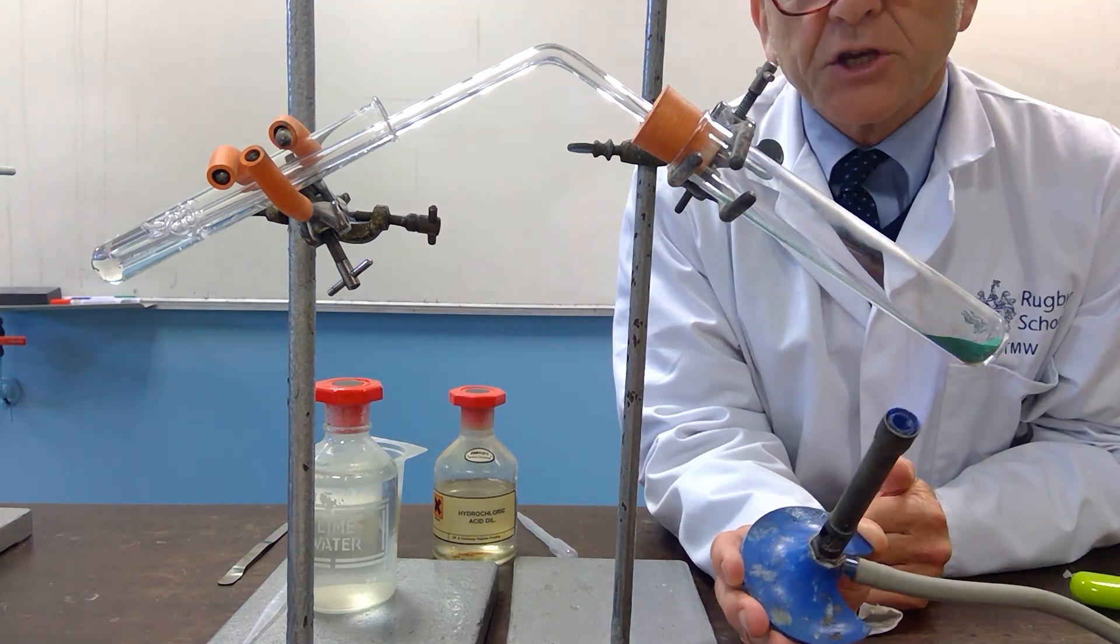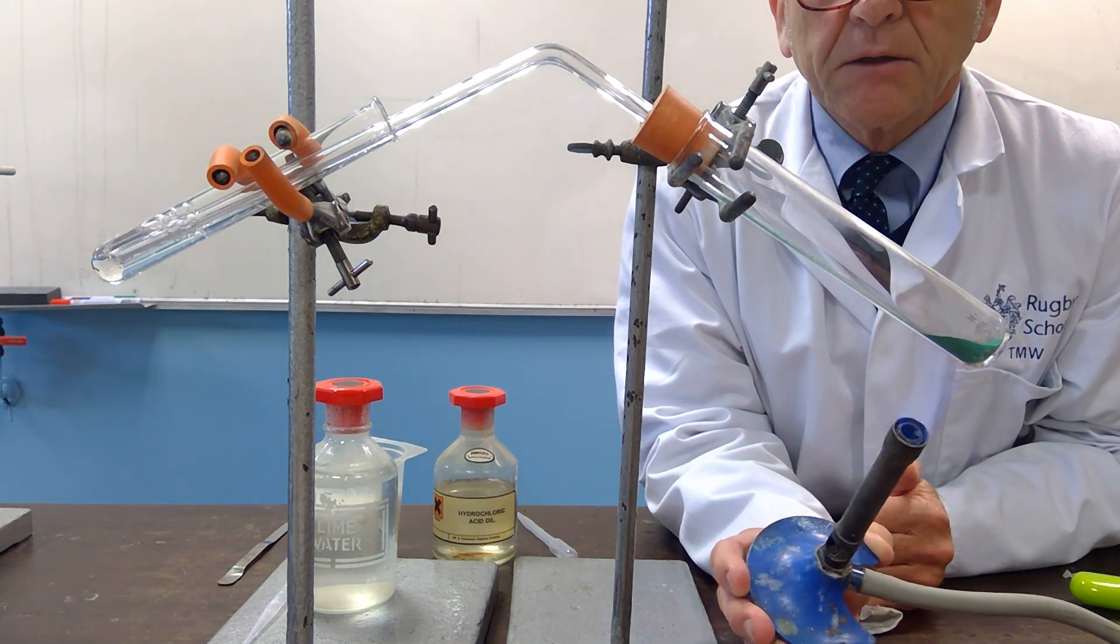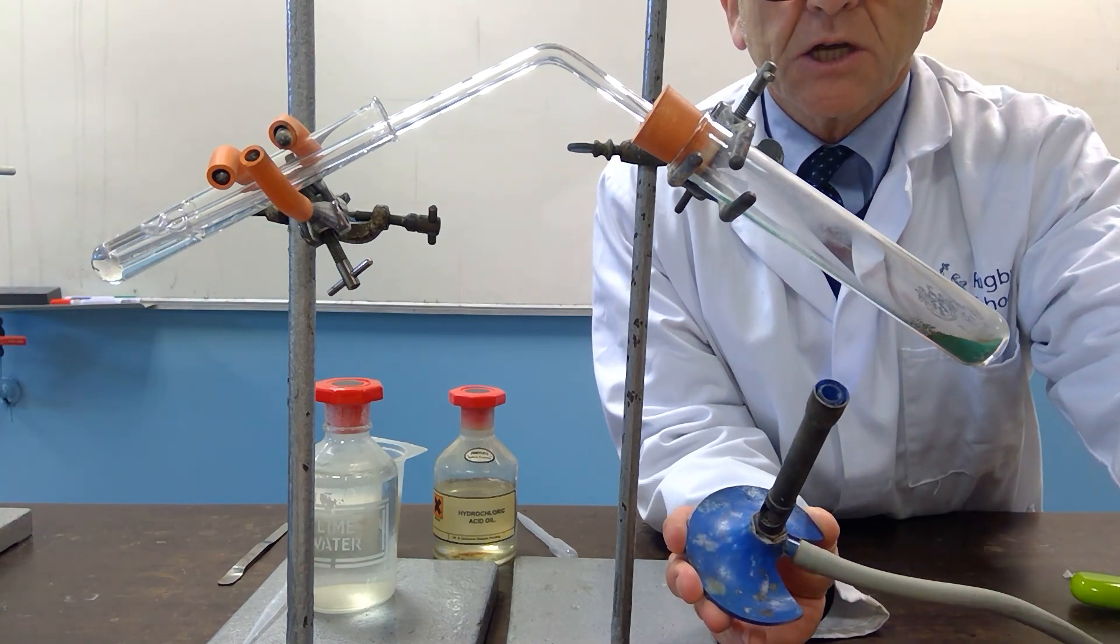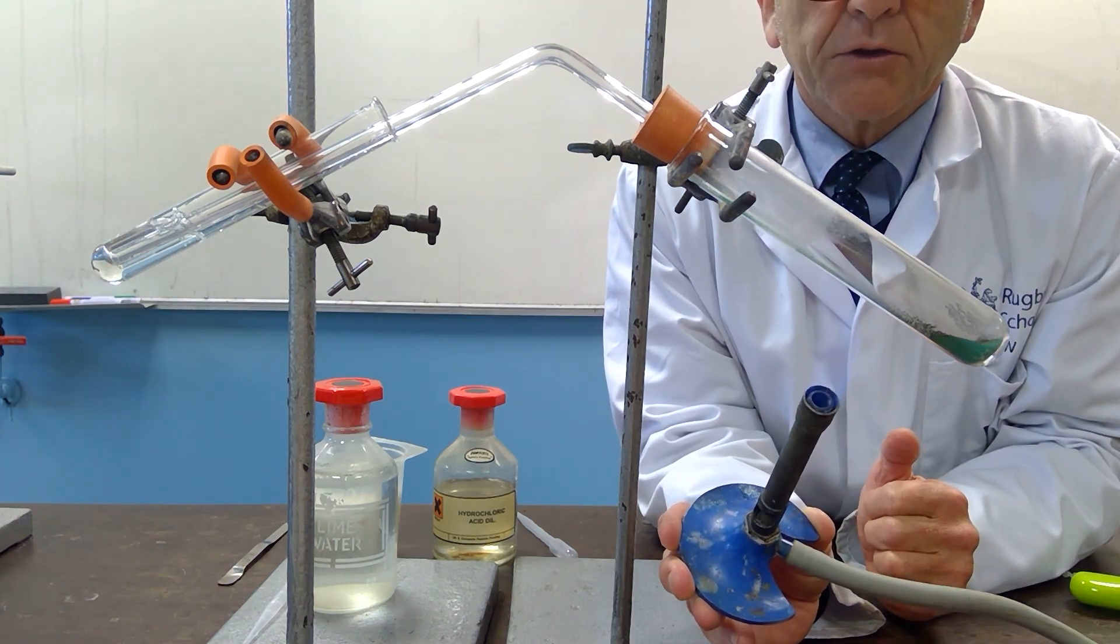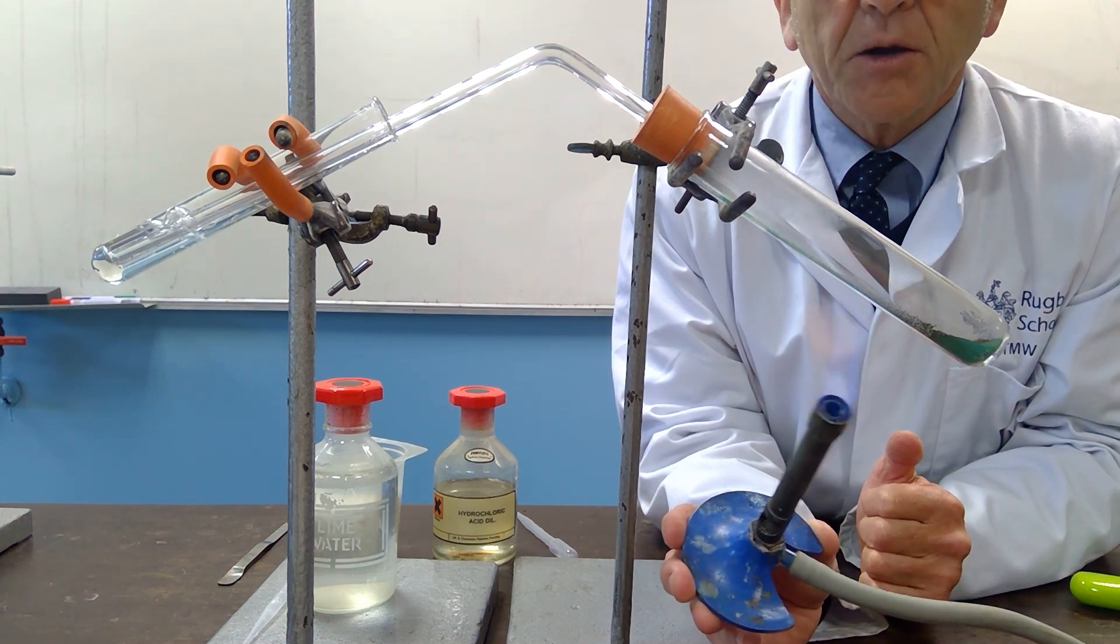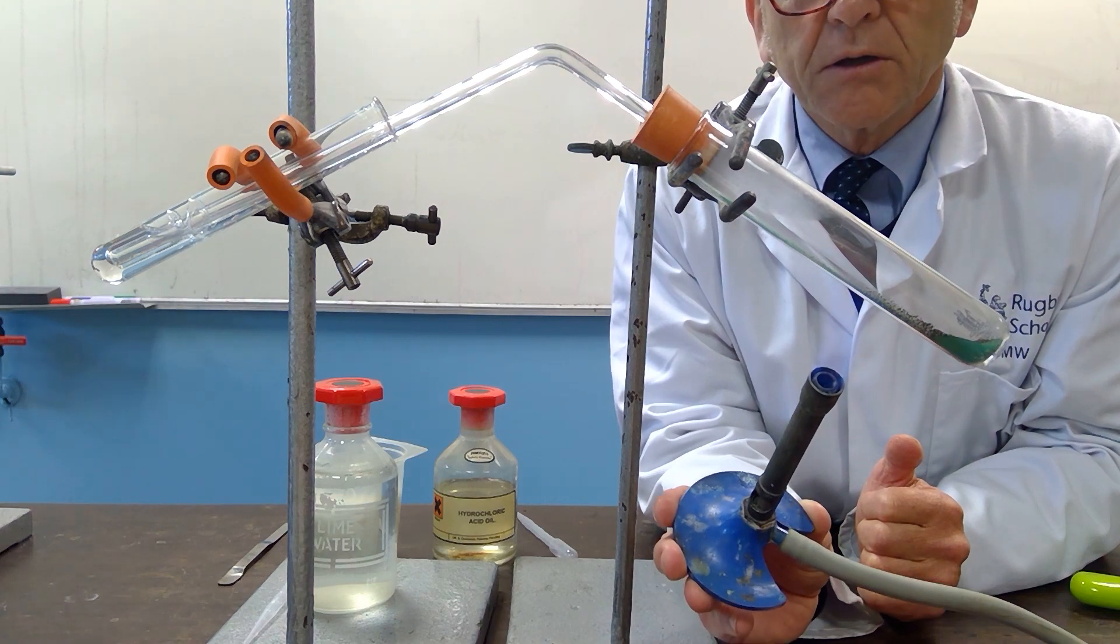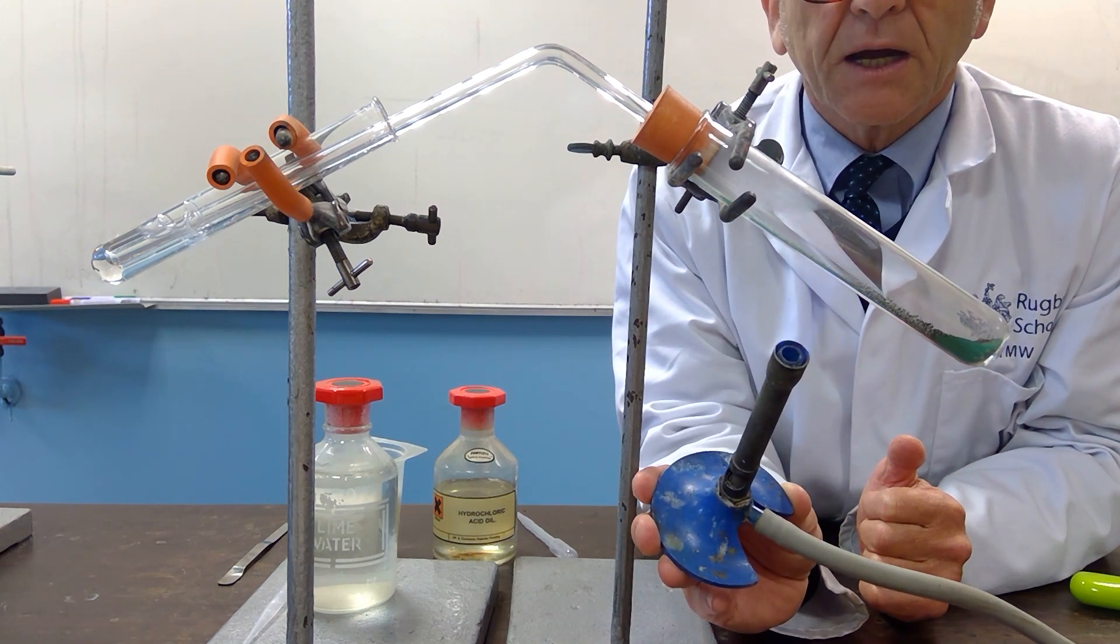The bubbling that you see at the moment is simply because air has expanded and is leaving the glass. As I start to warm you'll see that the green copper carbonate is turning to a black colour.